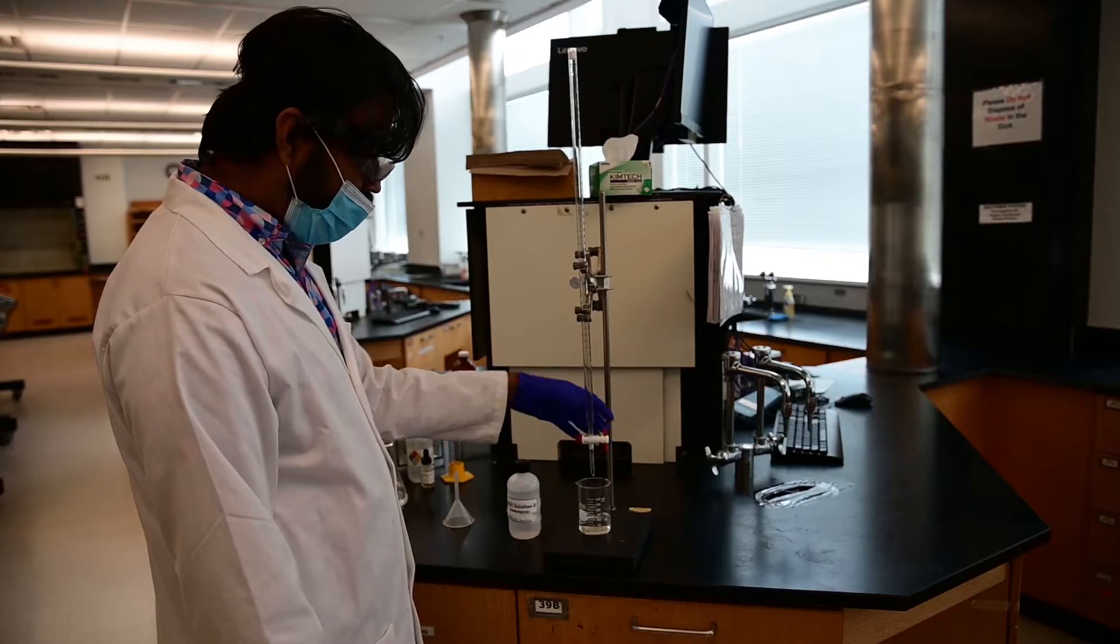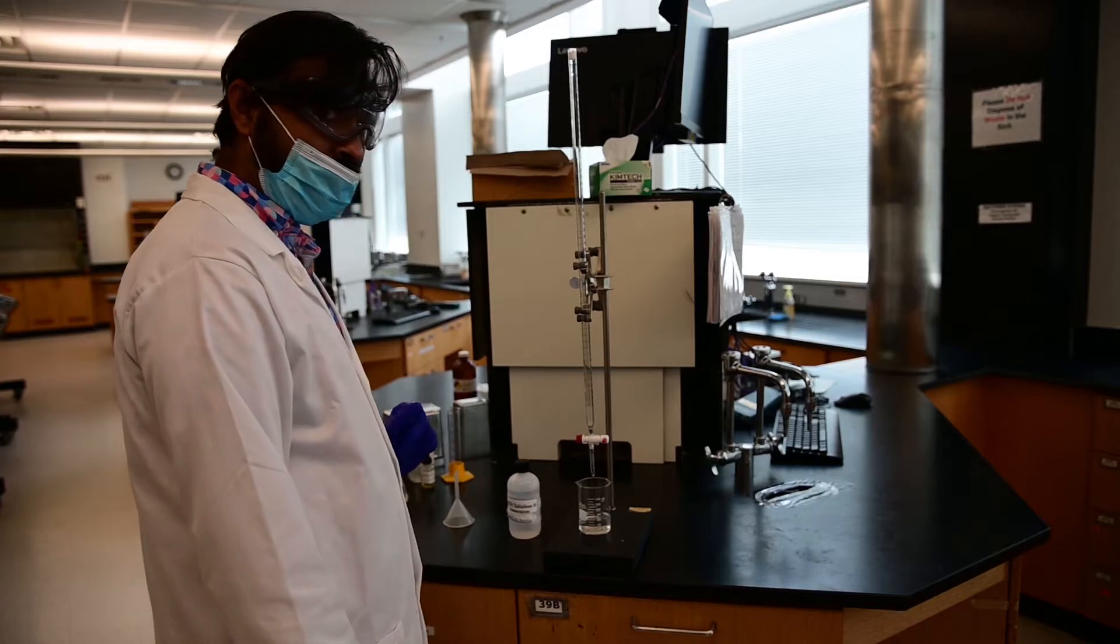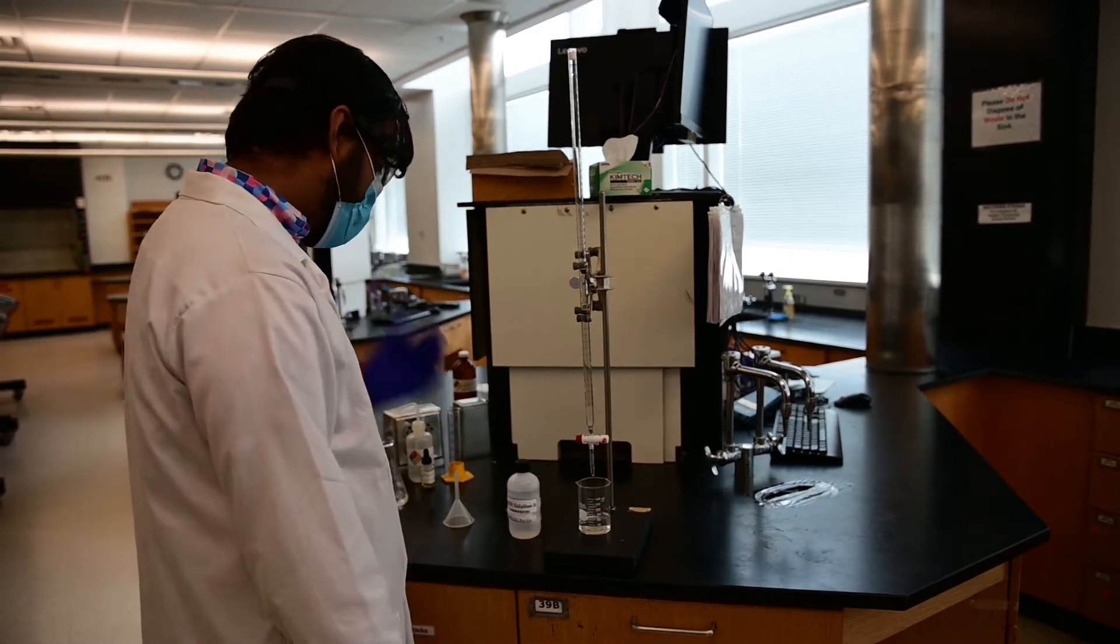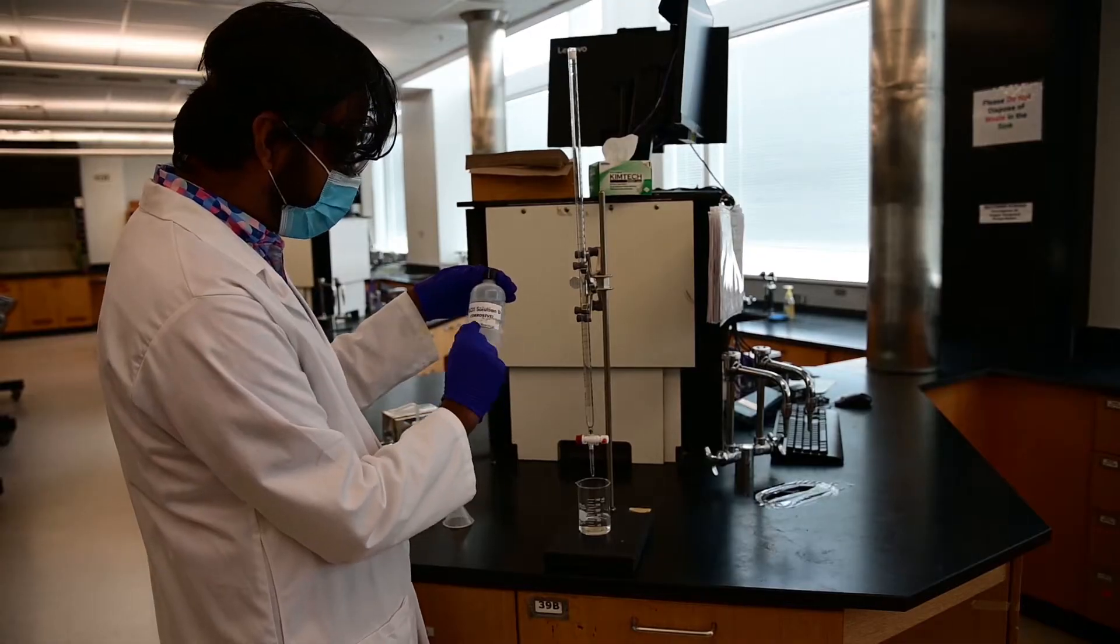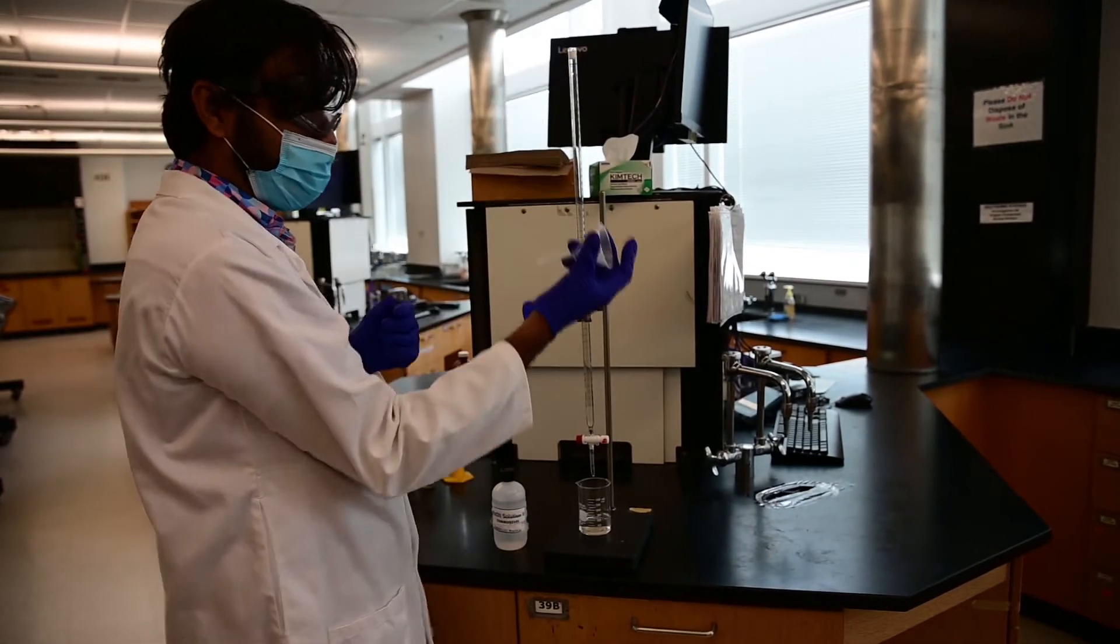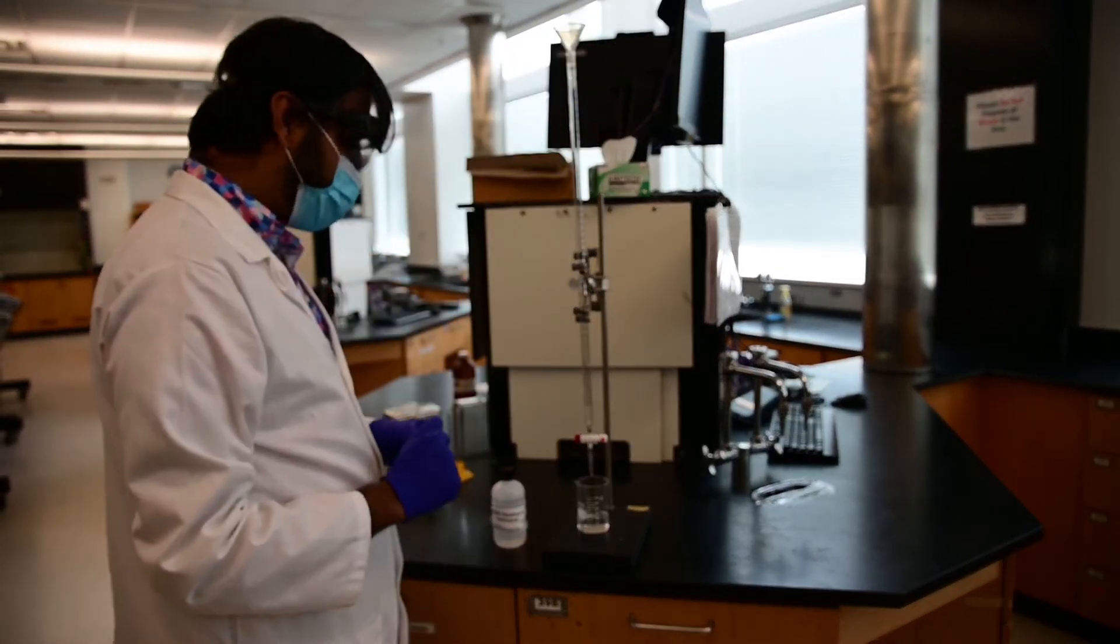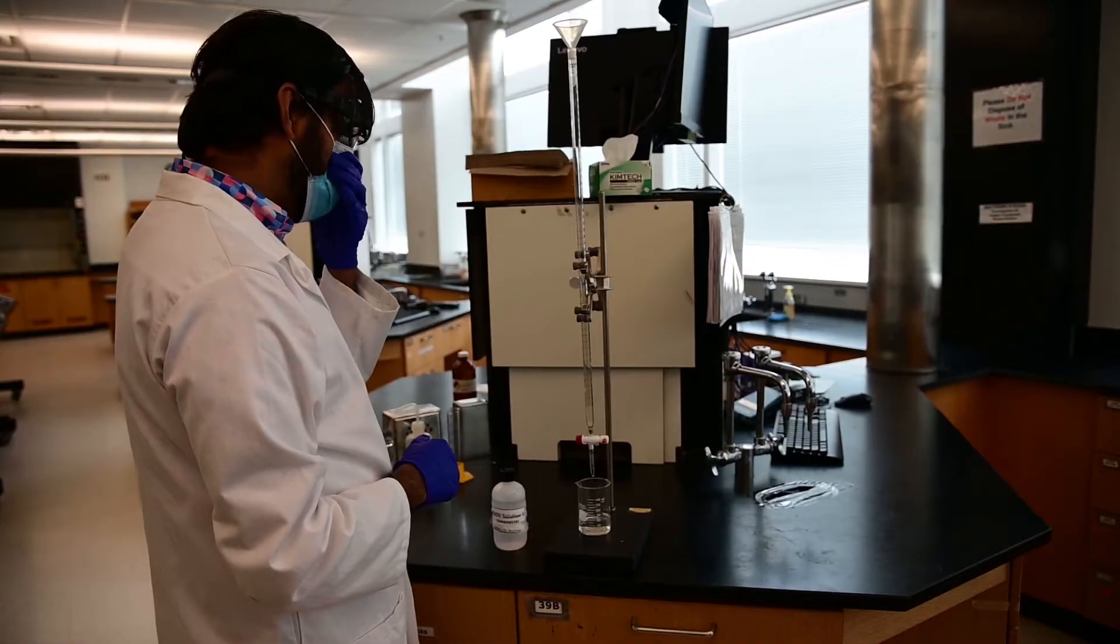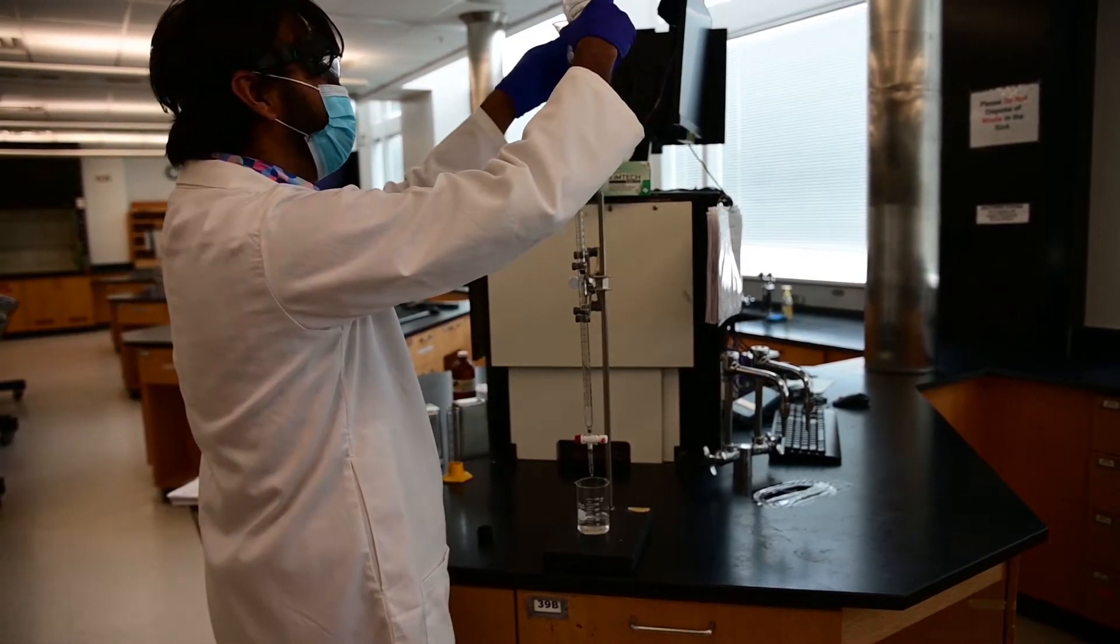Now that the burette has emptied, make sure you're closing the tap before you pour in sodium hydroxide. I have sodium hydroxide here. It says sodium hydroxide solution. It's corrosive. Now the first thing that you have to do is you have to place a funnel on the burette, which makes transferring sodium hydroxide in the burette easier. And then just pour a little bit of it.